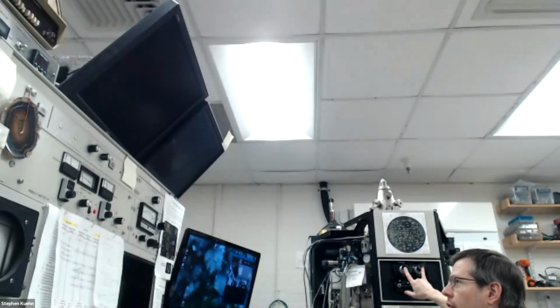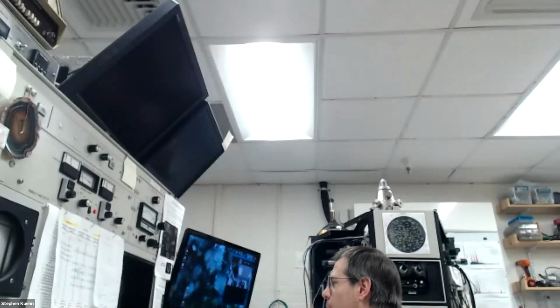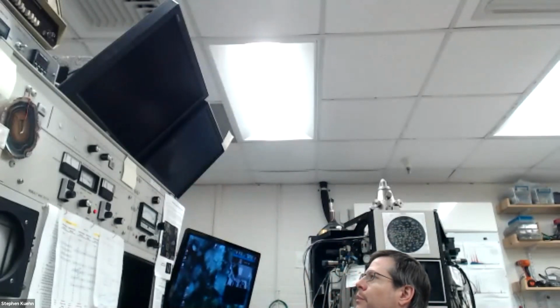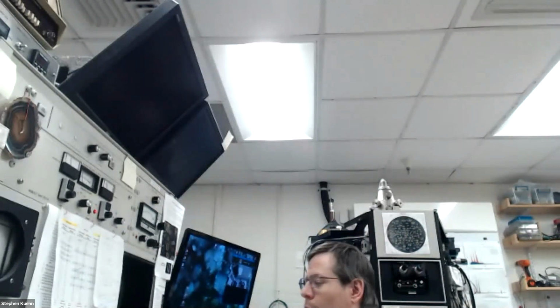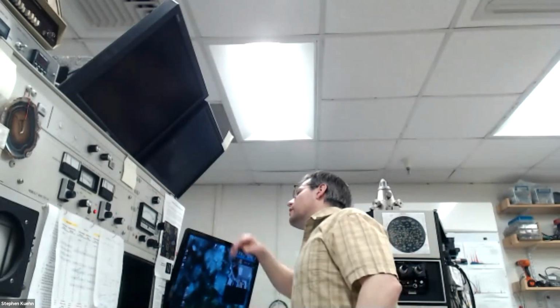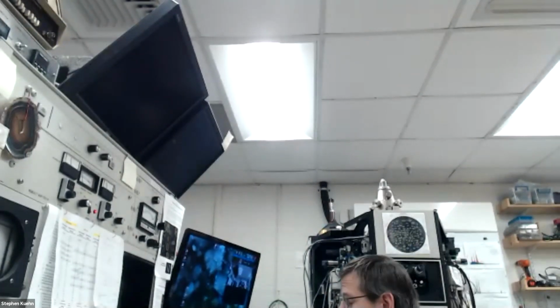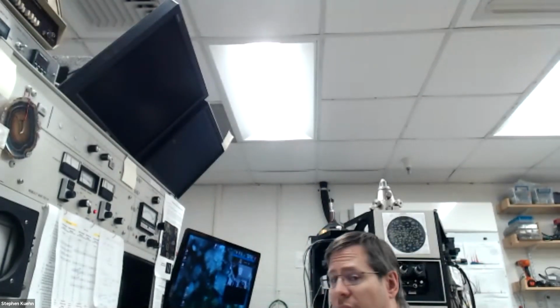You could actually look in here yourself. And there's a camera and it feeds up there. And usually we use that to make sure things are in the right place. But when I try to do a nice image, the light bulb for that, it's actually an LED, causes a little bit of flickering in the image, so I'm going to go and turn that off. And then let's back down.